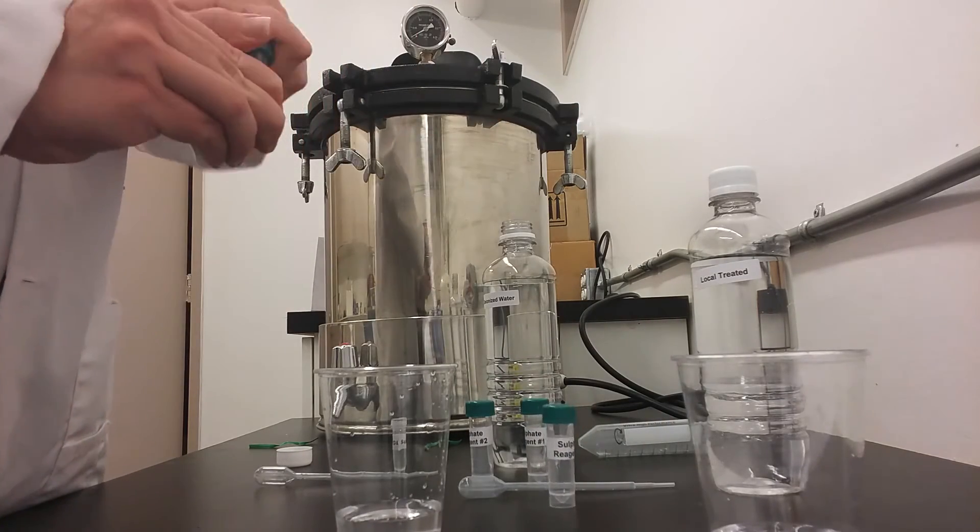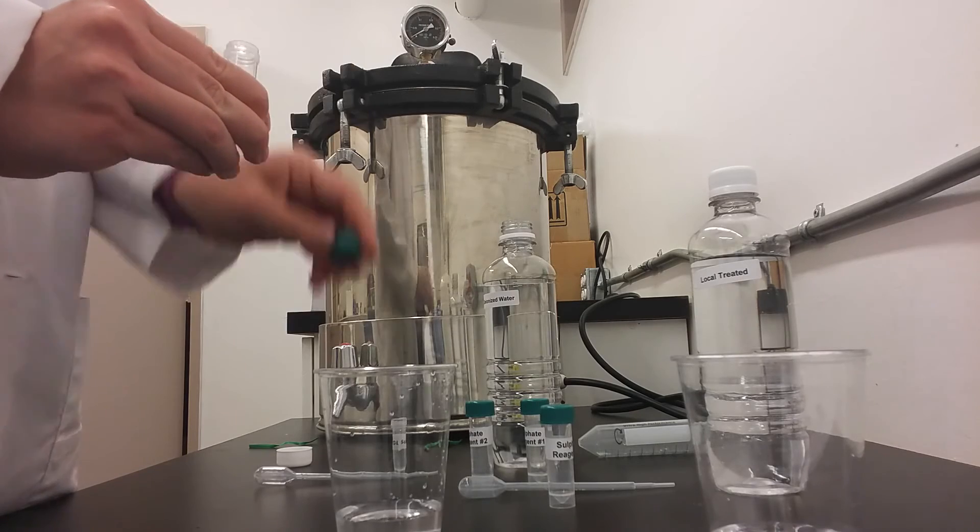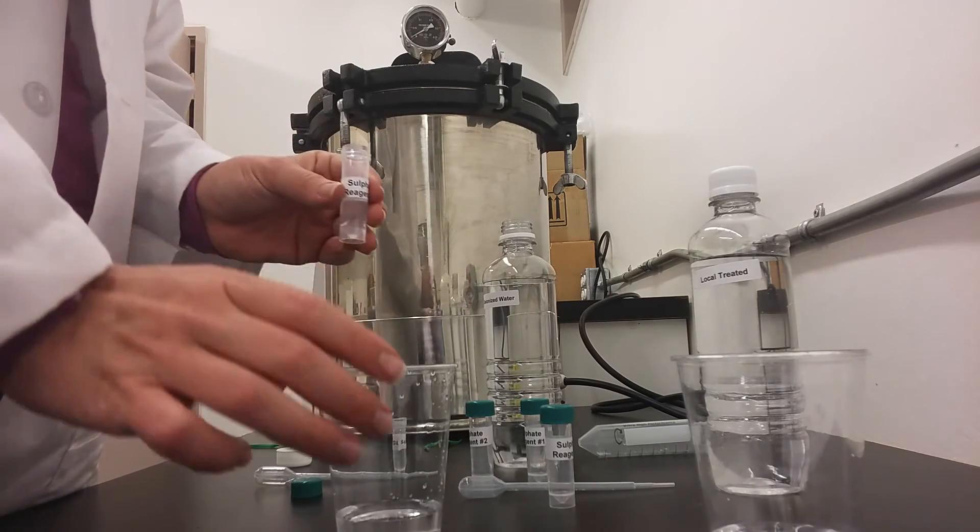And again, while swirling the cup, you will add sulfate reagent number 2.